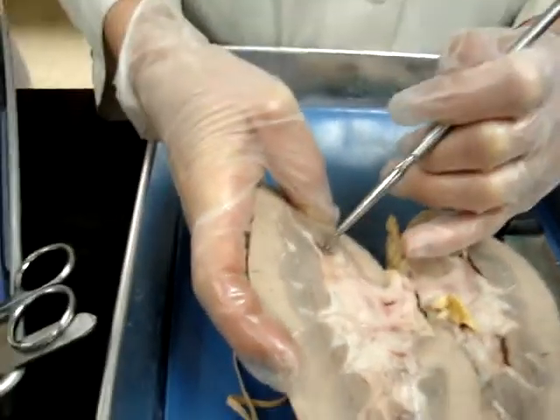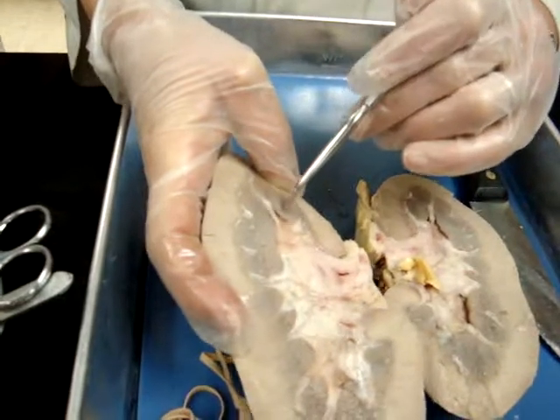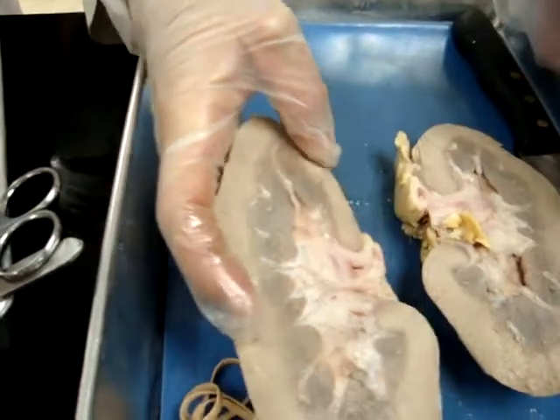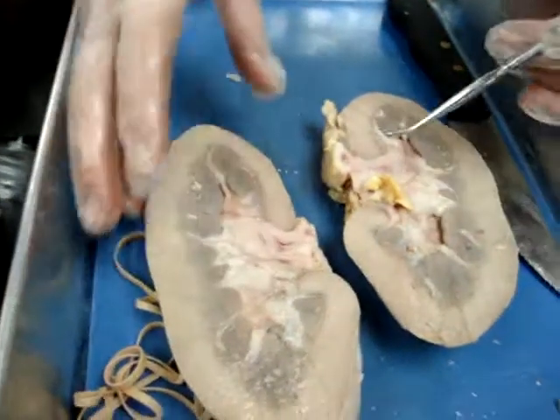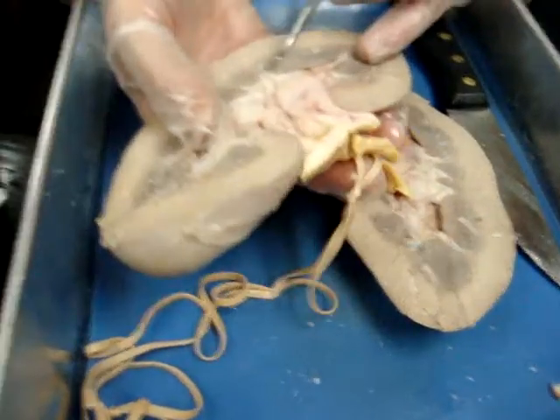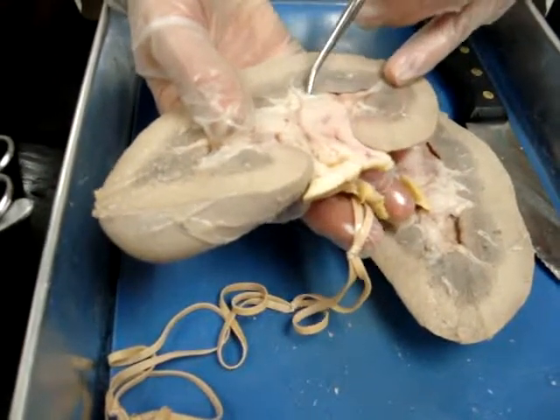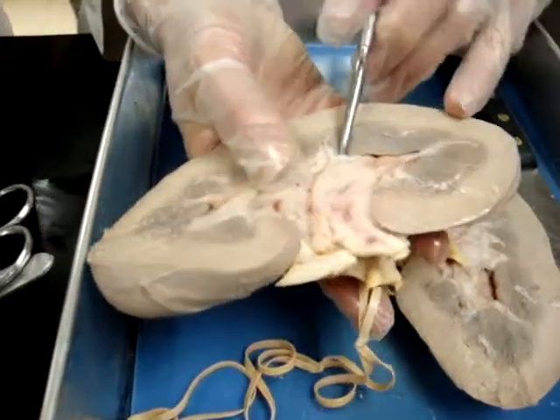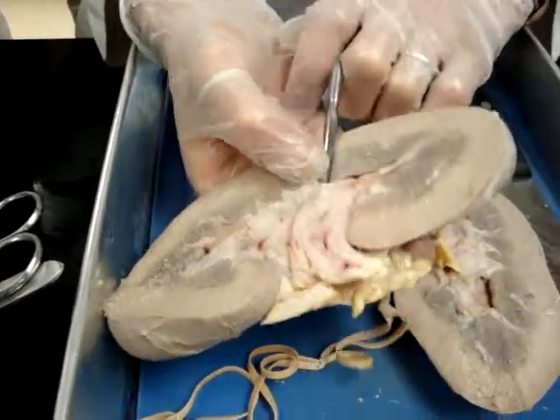What do you call that? Around every papillae of the pyramids. Those minor calyxes, if I follow into one — I'm going to get in this one here I think — are going to lead to a major calyx.